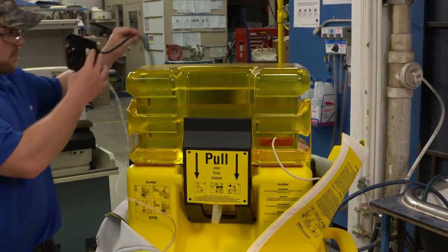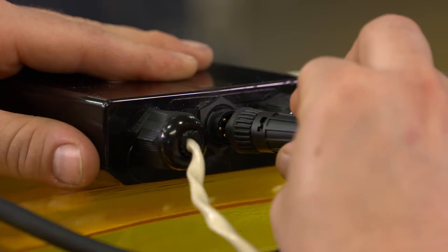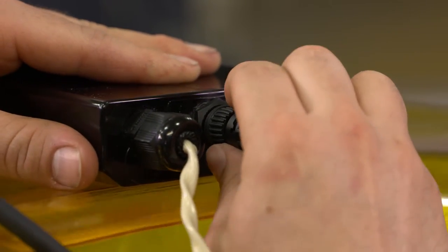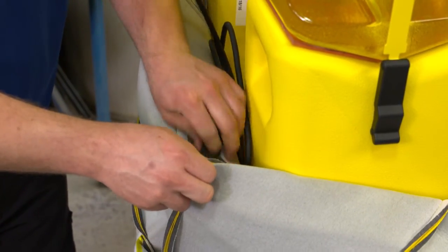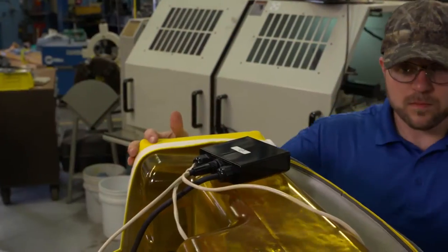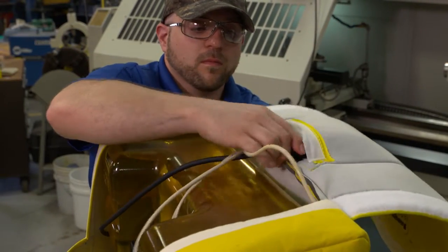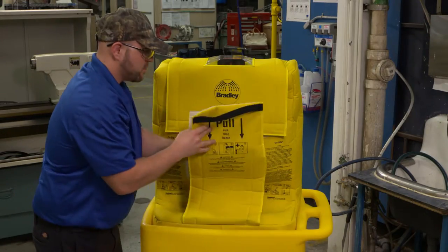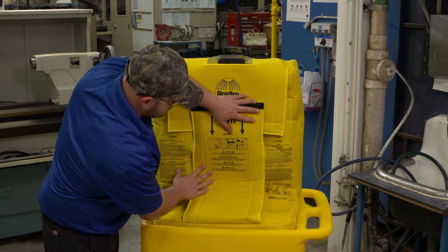Run the junction box around the unit. Insert the five-pin connector from the tank heater assembly into the mating socket on the junction box and screw tight. Run the power cord down the back and out through the velcro opening at the bottom. Pull the heater jacket up around the tank and place the junction box into the clear pocket. Move cables and cords clear of the eyewash and slide the eyewash arm into the pocket of the jacket flap. Velcro the eyewash into place.